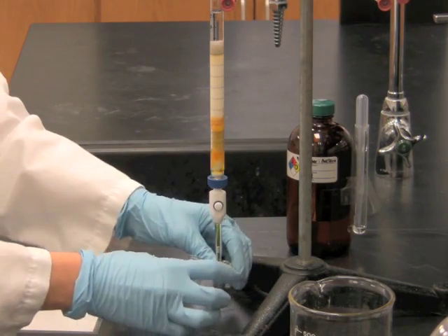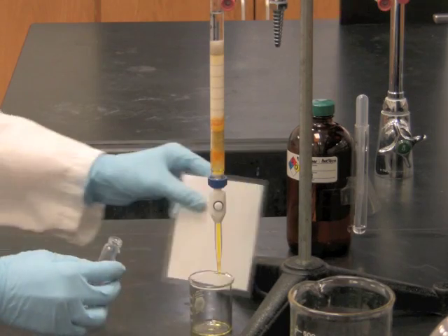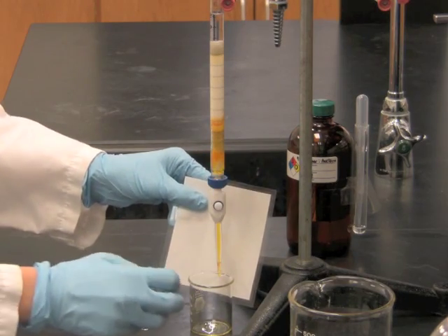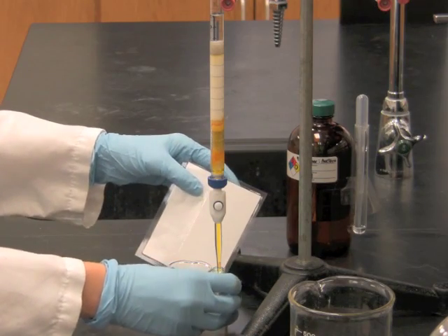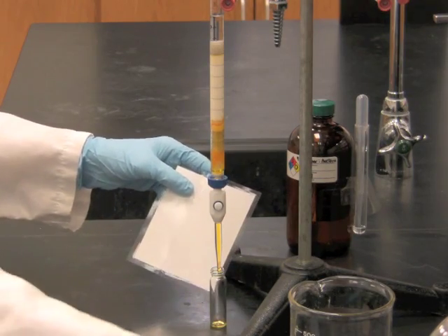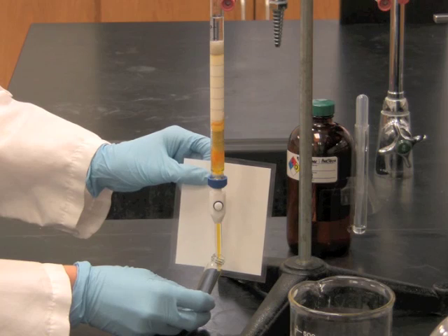If you are collecting lycopene for further analysis, you can see that the lycopene band is starting to exit the column. So you can switch to a small sample vial to collect the lycopene itself.